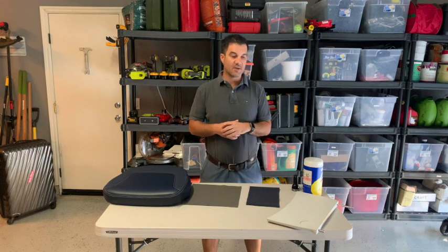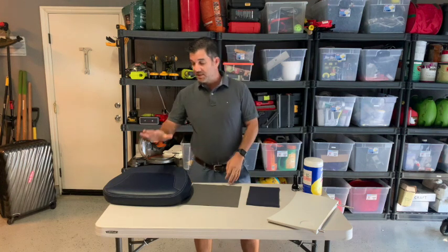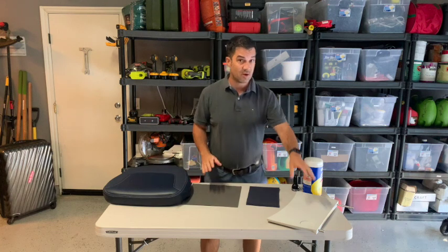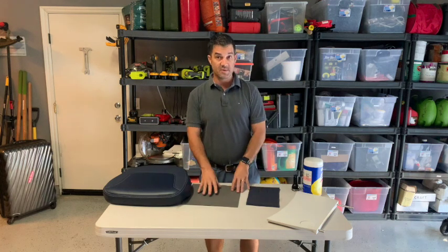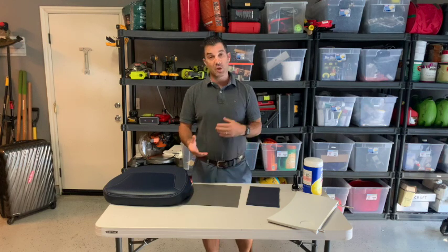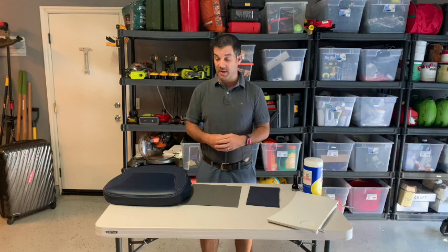Thanks for joining us today as we look at how microorganisms spread in a typical aircraft cabin interior. So what we've got today is a sample aircraft seat cushion, a sample aircraft tray table, and some materials. We've got some fabric and some synthetic leather that we're going to show you the differences of how easy it is for a microorganism to spread throughout the cabin.